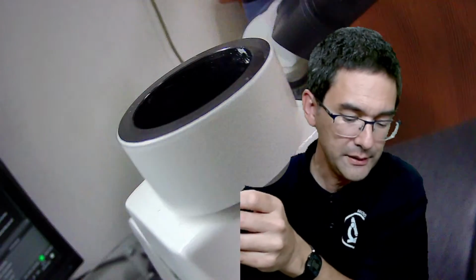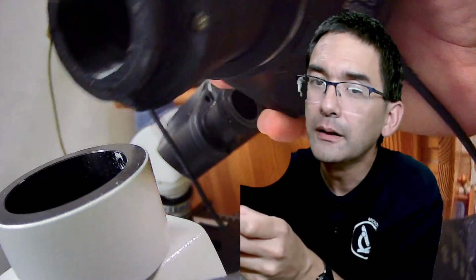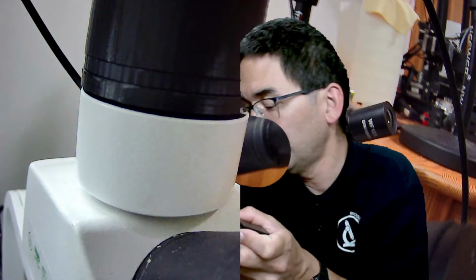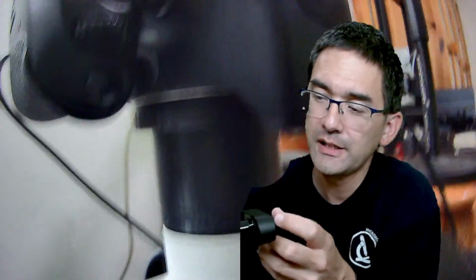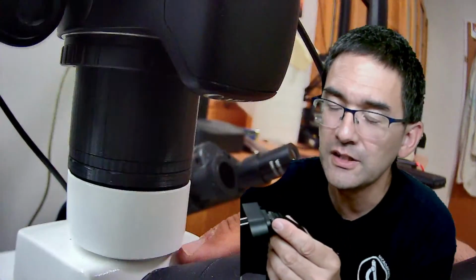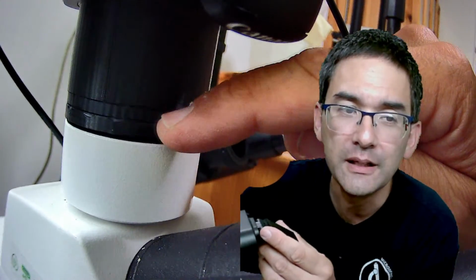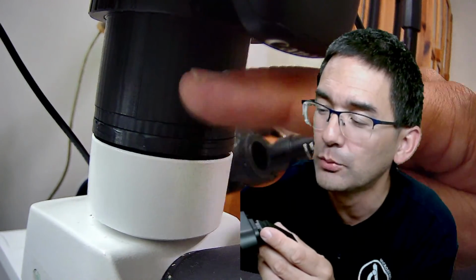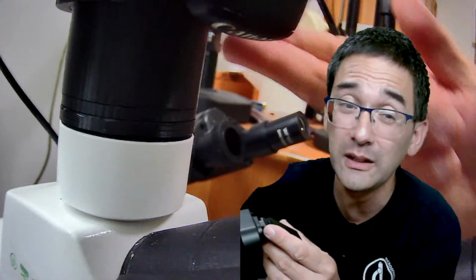And I 3D printed this part. Okay, and I can now insert it directly here on top, and I can tighten the little screw again so that the camera doesn't fall off. So what I have now is, by lowering it, the objective is now going to directly project the image into the sensor. And maybe you can see an additional ring in here. That is because initially when I made it in 3D, it was too short. It was a little bit out of focus, so I extended it a little bit. That's the only reason, but it's only a tube.